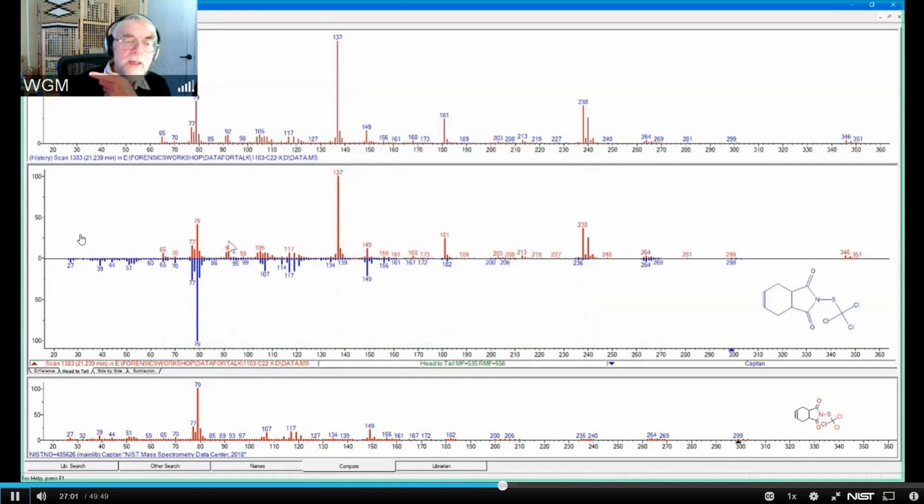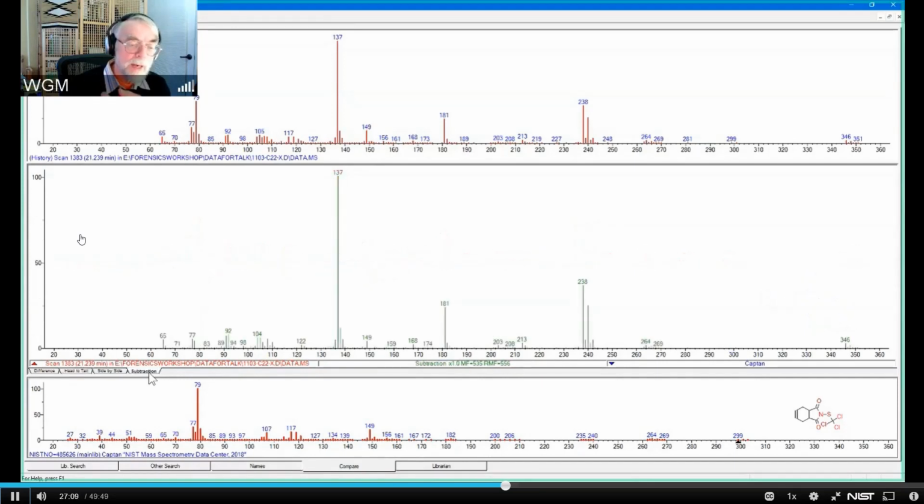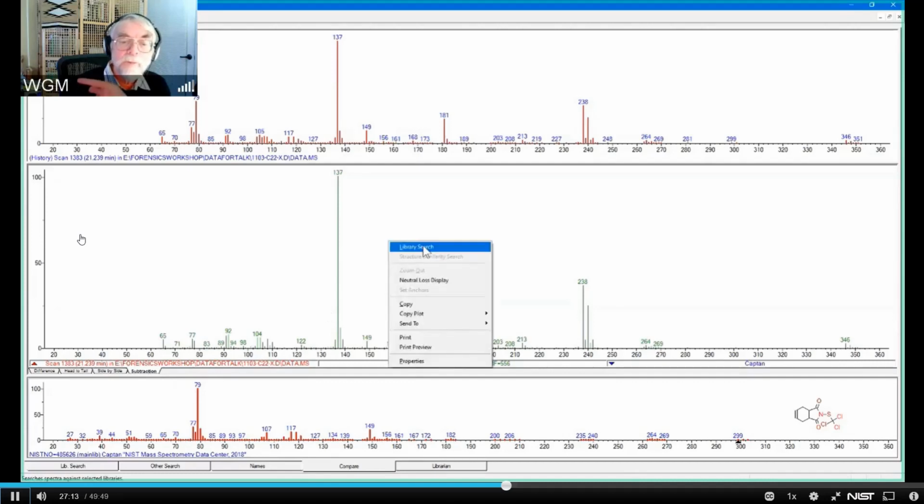And so now here's the head to tail. This is captan and the single scan. Again, just by clicking on this button, I get the subtraction, and I can search that.